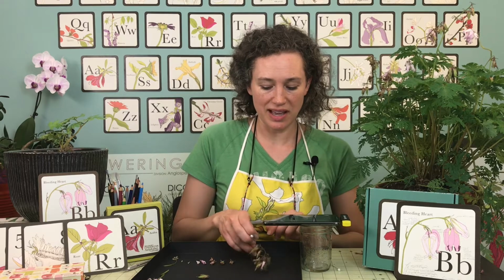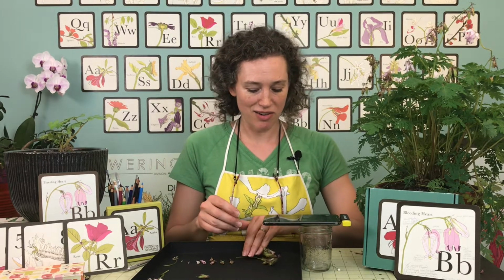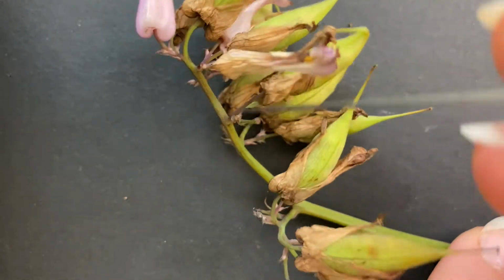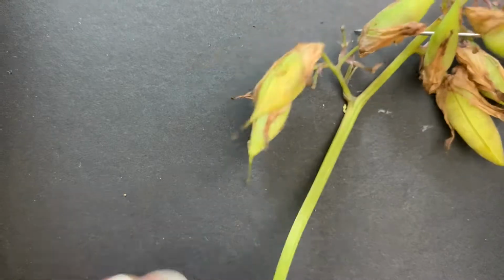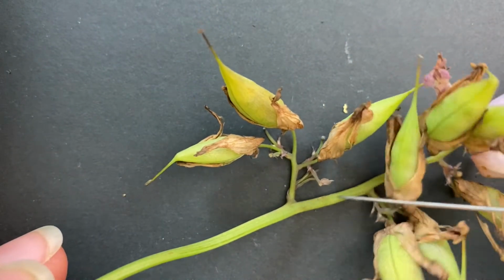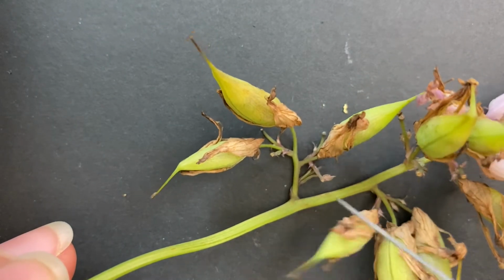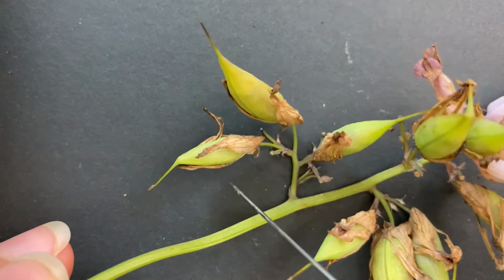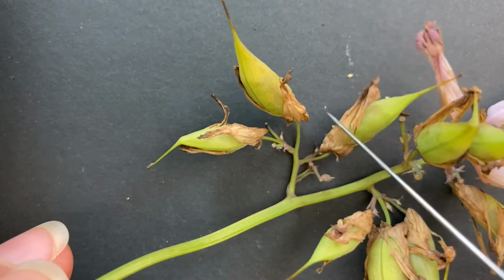This is one that has been around for a while, as you can see. These are all enlarged ovaries. So here's a great example right here. There's this central stem and then a branch off the central stem. And right here we have three that are really easy to see. And it looks like there was maybe another one there.